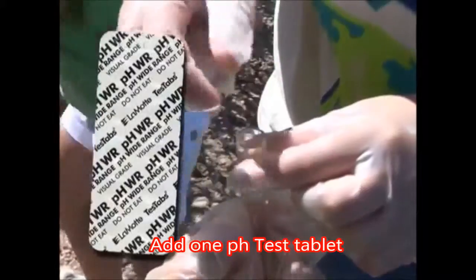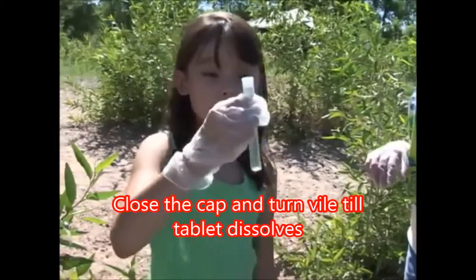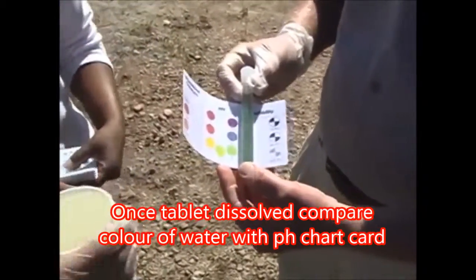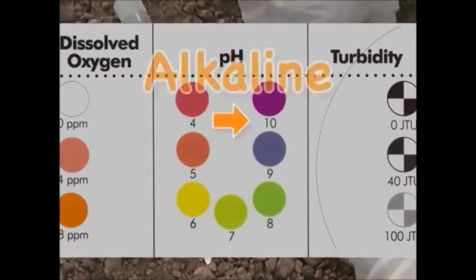Add 1 pH test tab, place the plastic cap on top, and turn the vial end to end for a few minutes to dissolve the tablet. Once the tablet is mostly disintegrated, with only a few small undissolved bits, you can compare the sample to the pH color chart on the card. Note the value, which will range from 4 acidic to 10 alkaline.